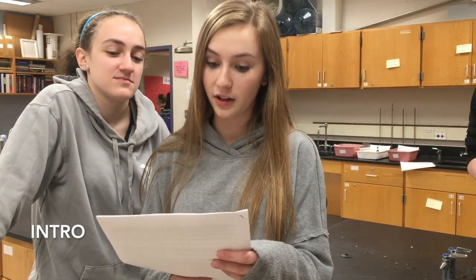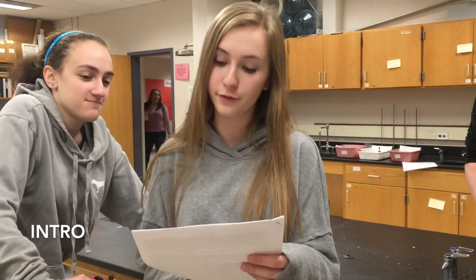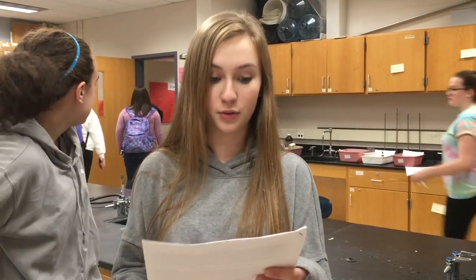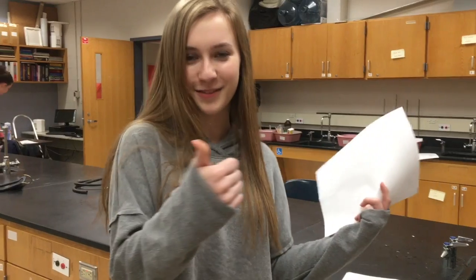VLab. So we're going to be using the entire palette of artificial food colors, and it's derived from just 7 certified dyes from the FDA for use in food, drugs, and cosmetics. So how can these FD&C dyes be identified in a mixture? How do the molecular structures of the dye molecules influence their properties relative to solubility or affinity for different solutions? That's what we're going to find out.